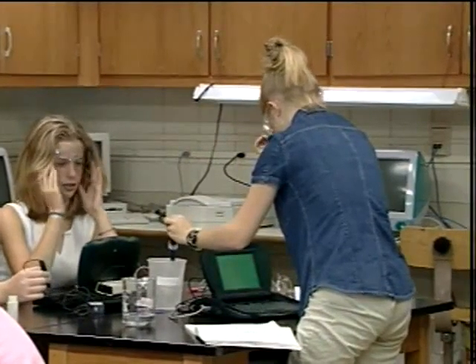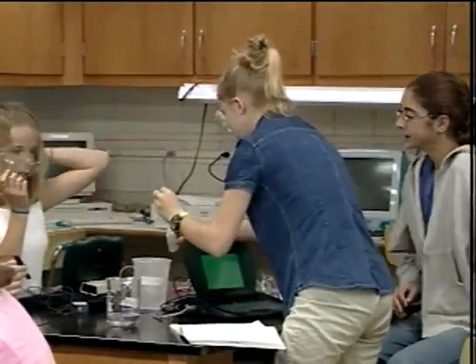We had several learning activities today. The main one centered around water quality at the stream. And the importance there that means a lot to us is that we take the students to the stream so that they can experience science outside the classroom walls. And that's what the technology has allowed us to do there. And so we can assess water quality data by the students not only collecting the data but observing it and everything that influences that data right there and experiencing it firsthand. The students carefully calibrate their equipment before making further preparations.